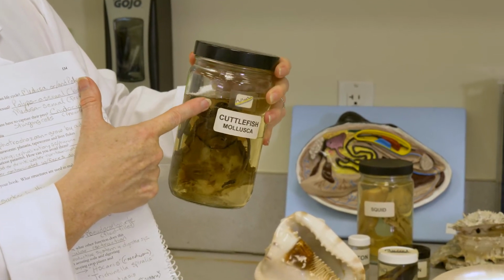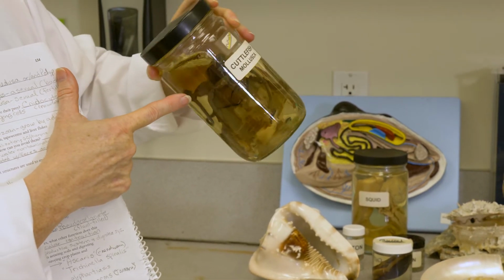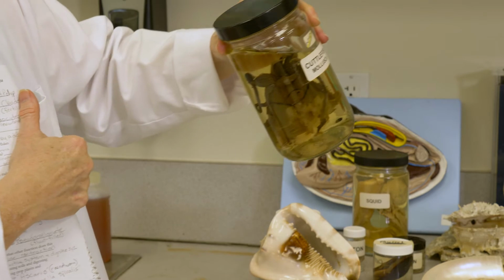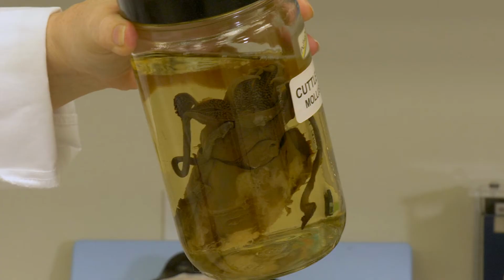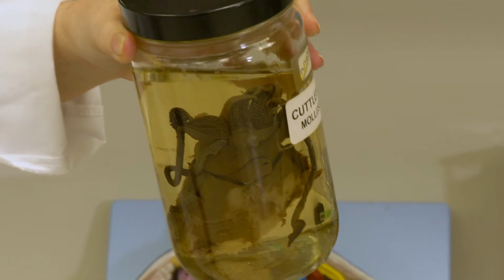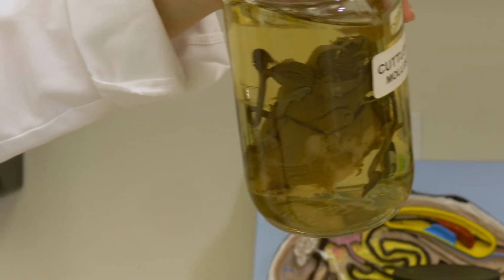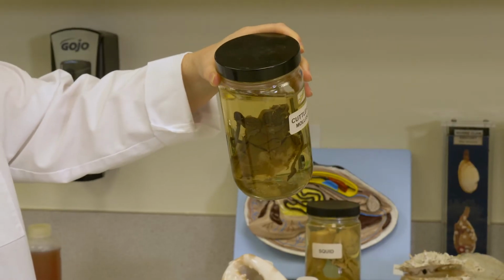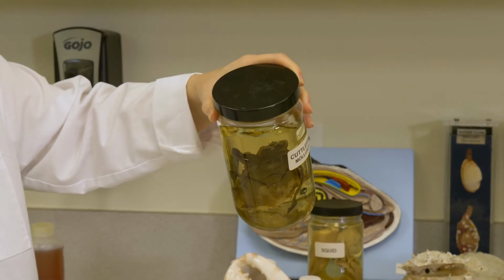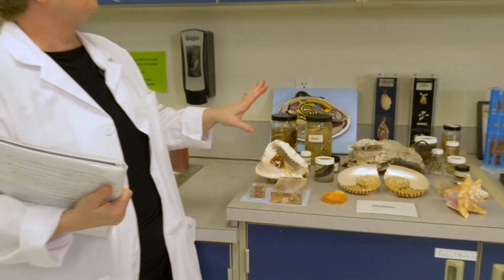have separated. And then, of course, it's hard for me to get the head section to come over here, but you can see this sort of internalized development. No, I'm sorry, not the head section, the tentacle section. The head section is down here in the main body, and then you have your tentacle. And those have sort of like a snail reversing itself and growing the other way and getting larger and becoming more specialized.